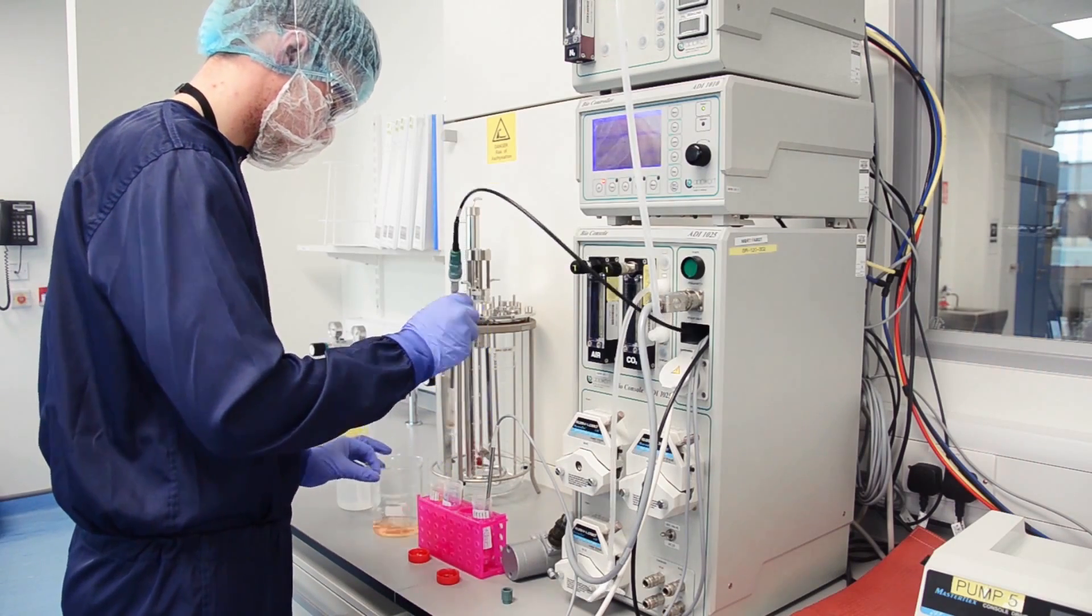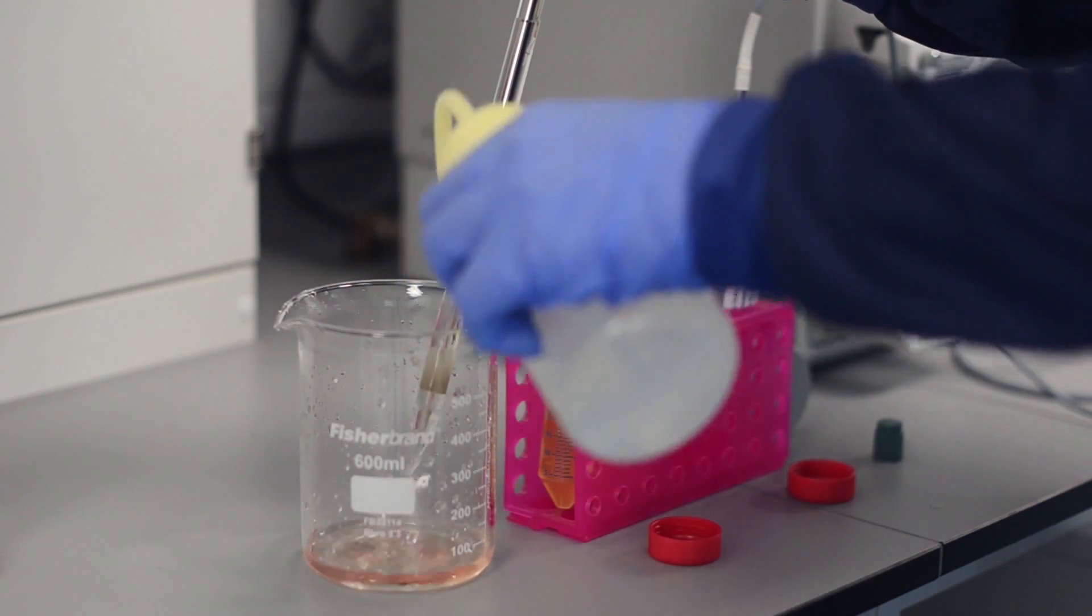It is then removed, rinsed and inserted into the head plate. The pH probe can be sterilized in place.